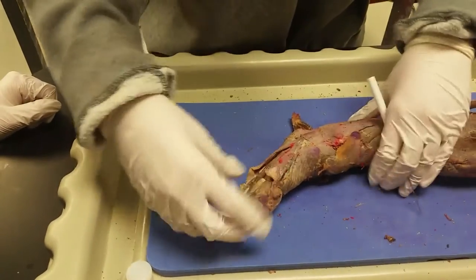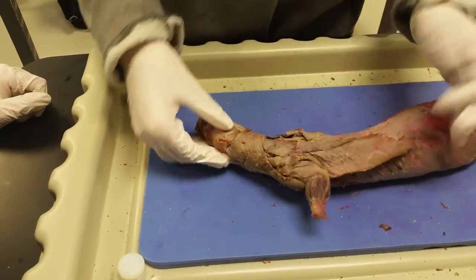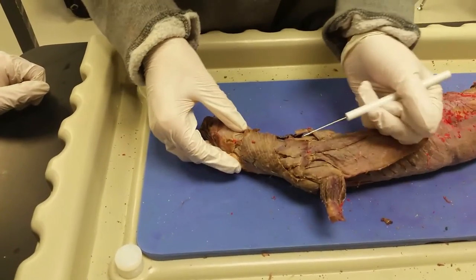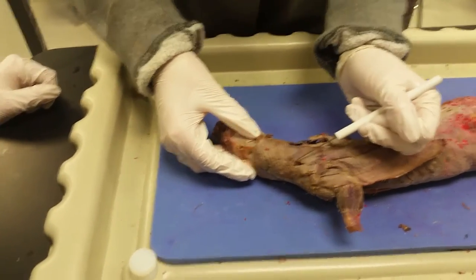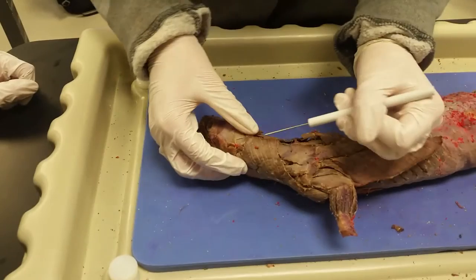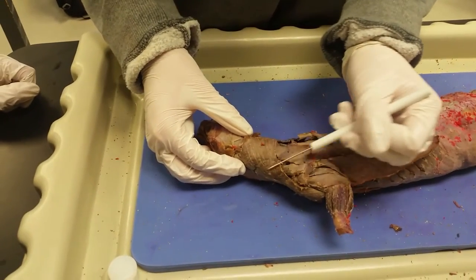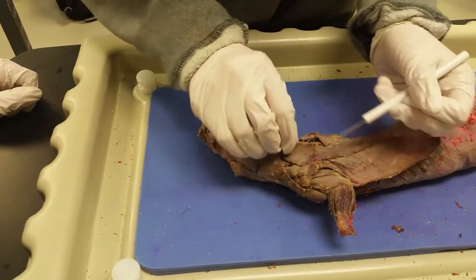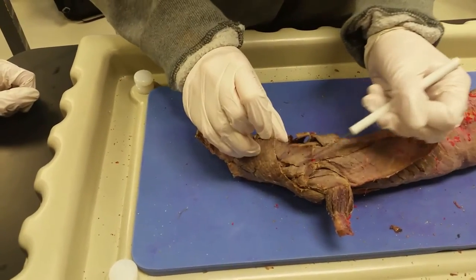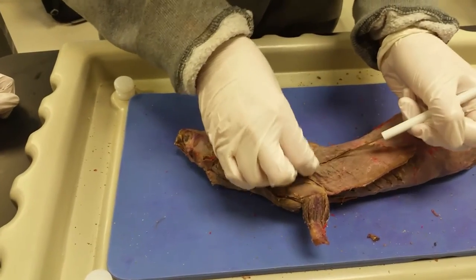And then, on the other side, you can see we have multiple trapezius muscles. The first one is the clavo trapezius right here. Then we have the acromio trapezius and the spinal trapezius.